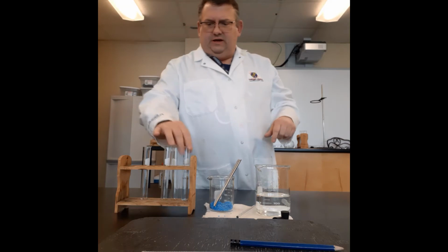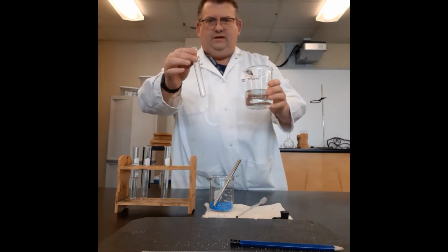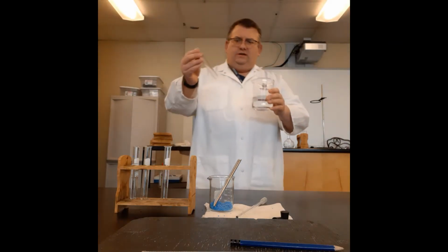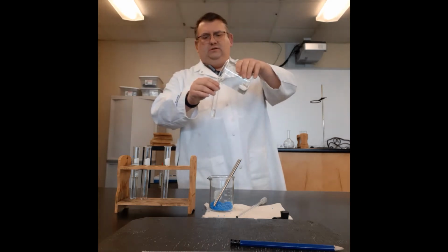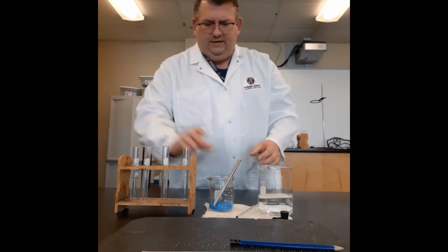So today we're going to start off, I'm just going to move this down here. We're going to start off with this chemical properties and physical properties lab. I've got a test tube and some water, so I'm going to put some water in the test tube, a little bit more than half full.